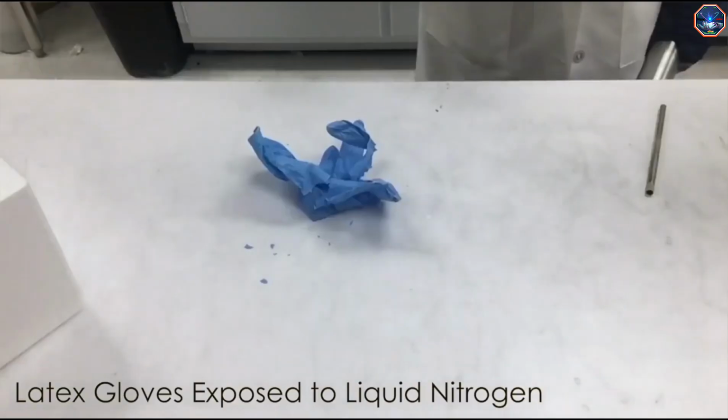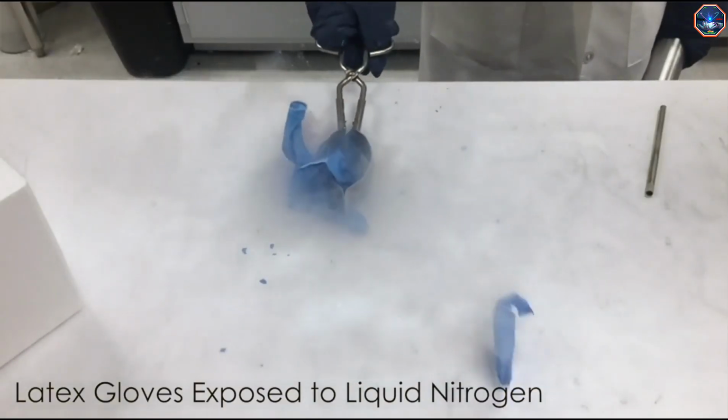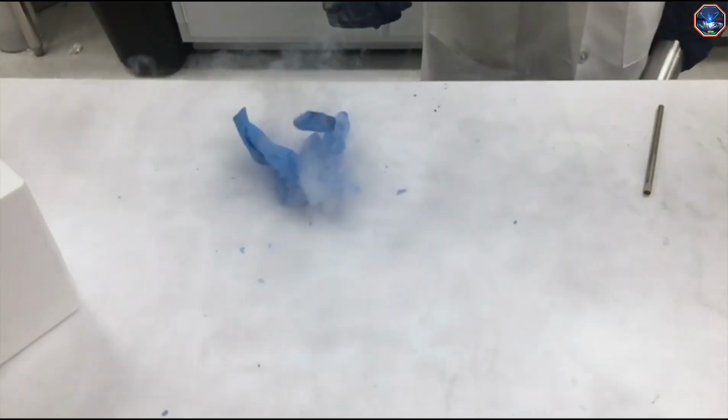When preparing cryo-TEM samples, you will need to change your gloves. Gloves become brittle when frozen and can freeze to your skin. Now we're ready to prepare our samples.